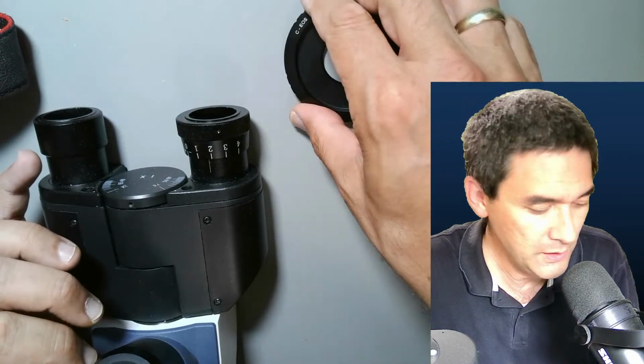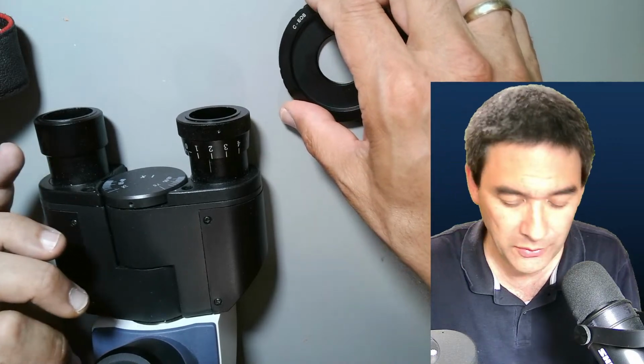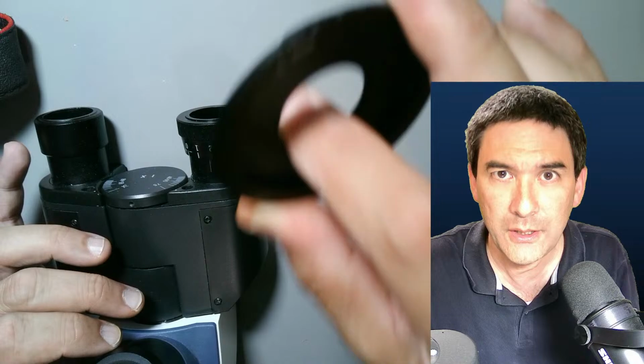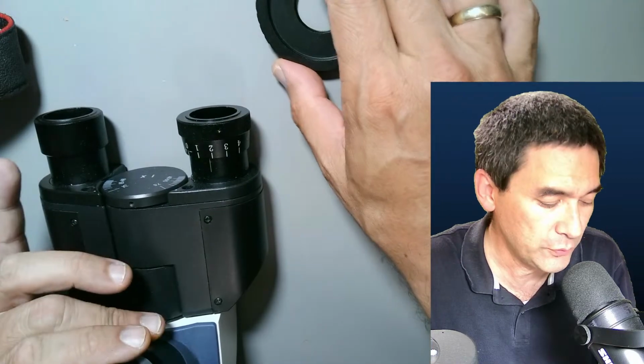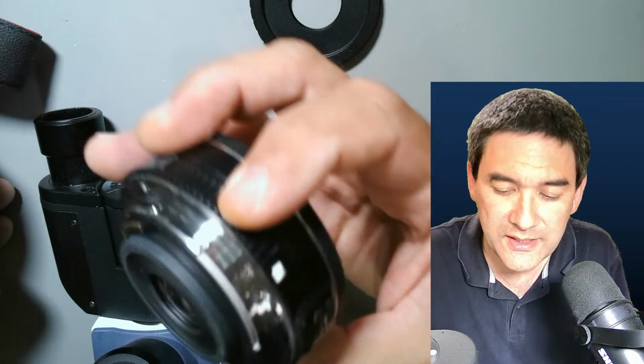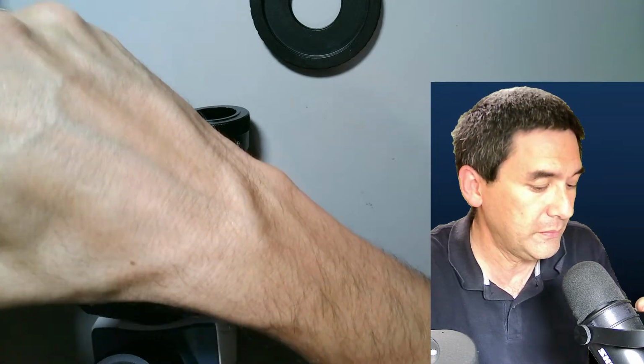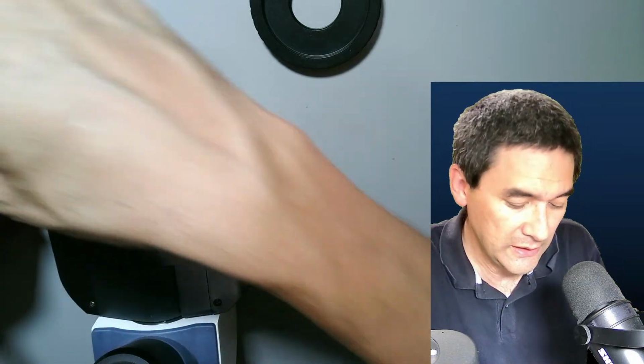Okay, so that's basically number 2 that I wanted to show you. And in my other YouTube channel, I will make a more detailed review of this, but simply because some people are really interested in this, I decided to show it to you anyway today a little bit, and maybe some of you might have questions, and I'm able to answer this as well. So let's put this away.